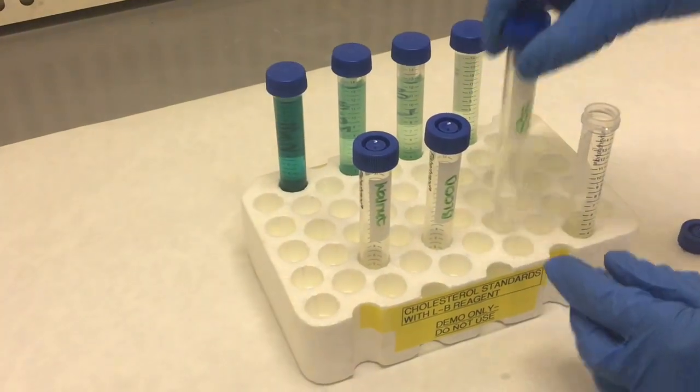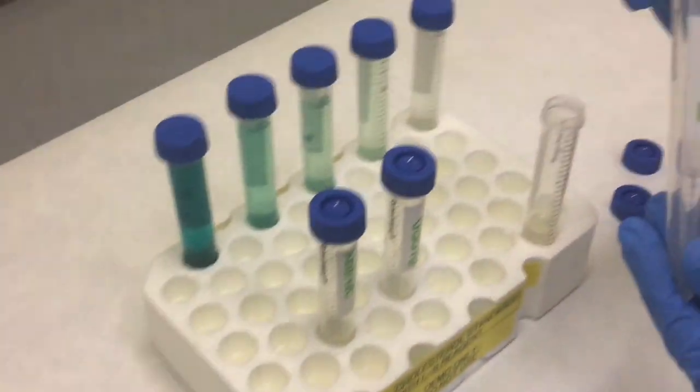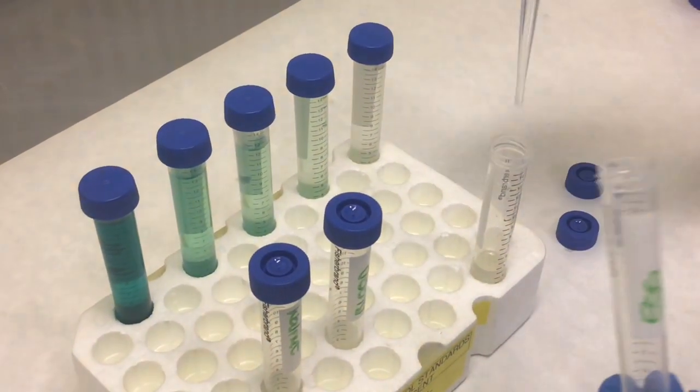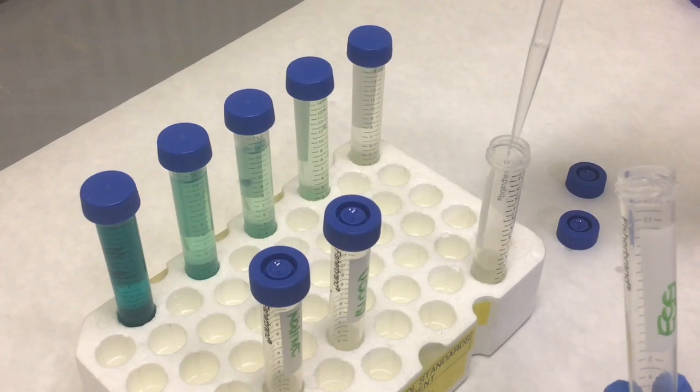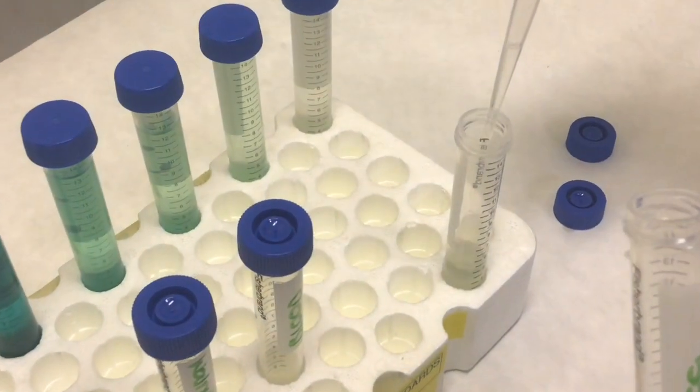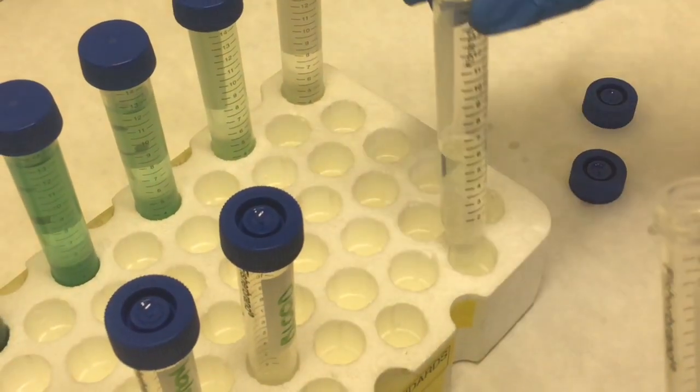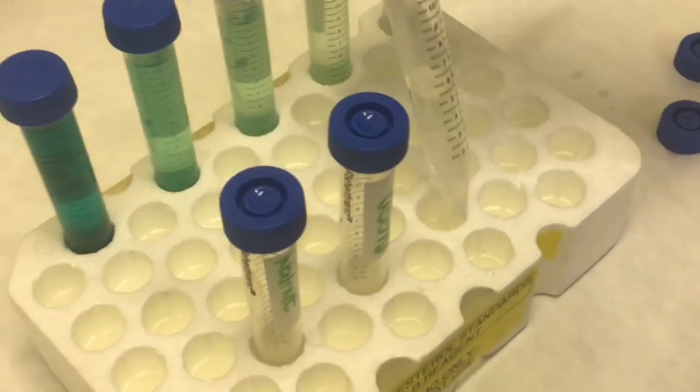The egg extract was added slowly to the Liebermann-Burchard reagent. As you can see, the egg extract is reacting violently with the reagent. It takes only a few seconds for the green color to start appearing in the reaction.